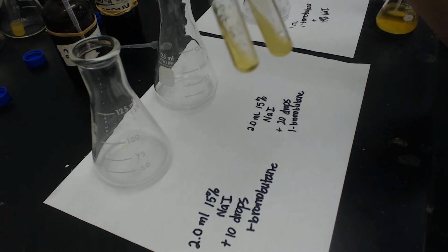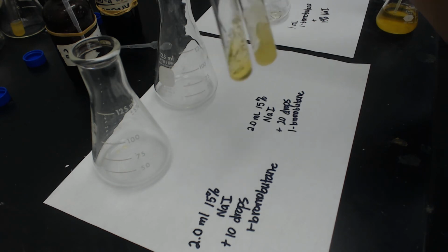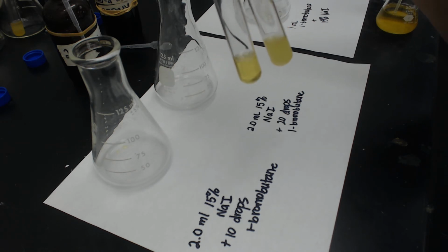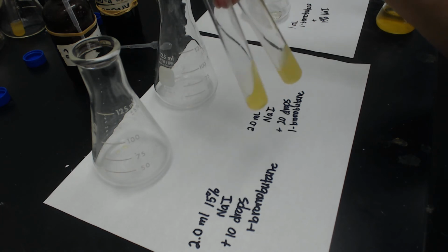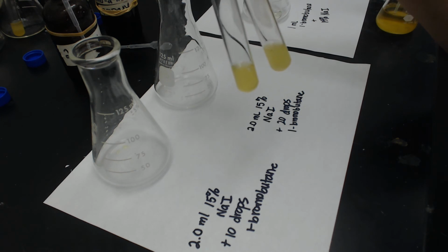I know it's really hard to say, well, so we've doubled the concentration. If I watch the time, it's not exact, but now the left one's starting to precipitate. So the one on the right went just about twice as fast as the one on the left. So the double concentration went about twice as fast as the lower concentration. So that's pretty much what we expect from SN2, that if you double the concentration of one of the reactants, you double the rate. And that's pretty much what we saw.